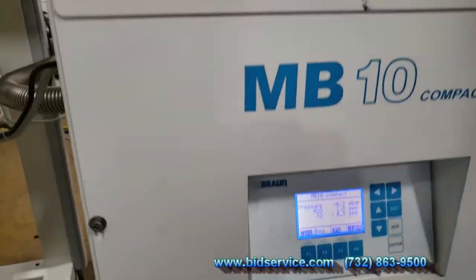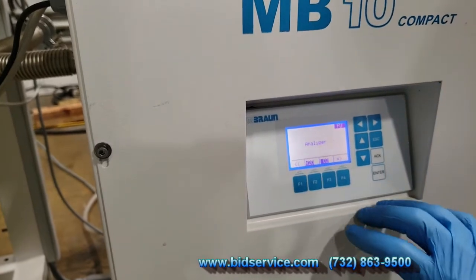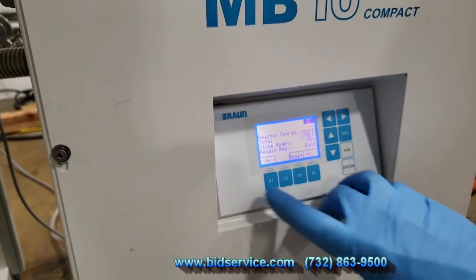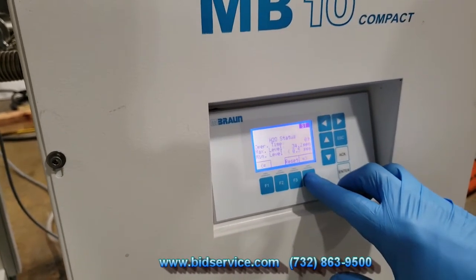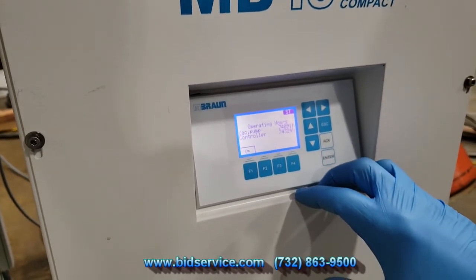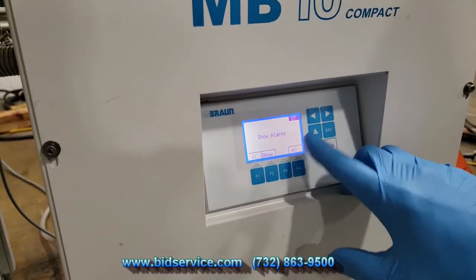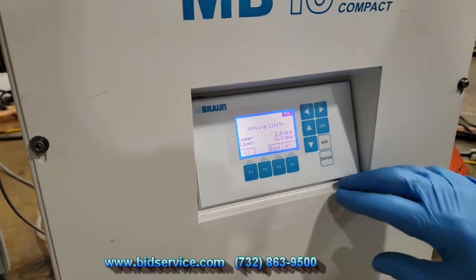Let's go back to our main screen. Just hit escape and get to your main screen. Down arrow — you can turn on your analyzers, we're both on right now. If you want to set alarms, you can just step through this different information on the box here. It shows you H2O status, O2 status, and operating hours of vacuum pump and controller. And we'll step back. From here we'll go up to working limits — right now I have the upper and lower limits set to plus and minus 2 millibar.